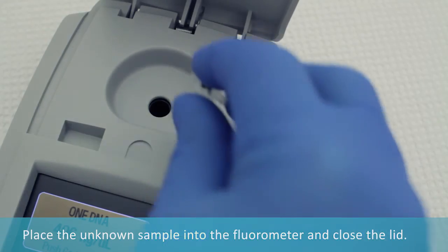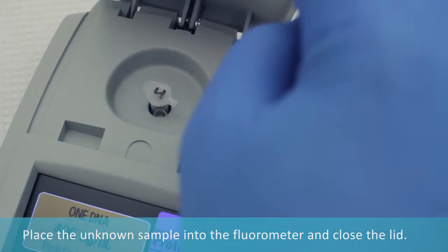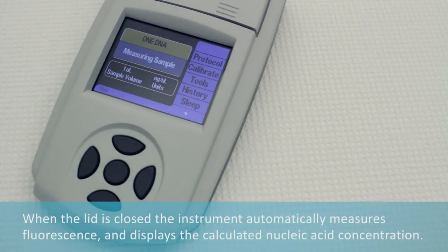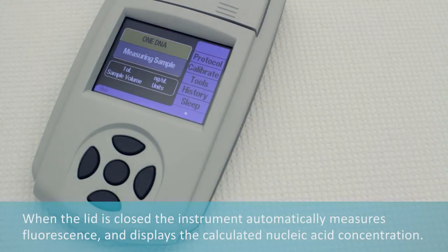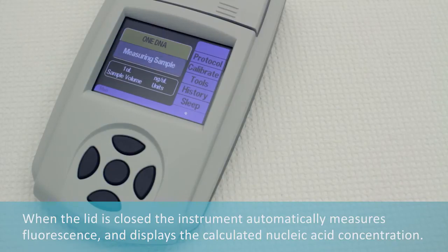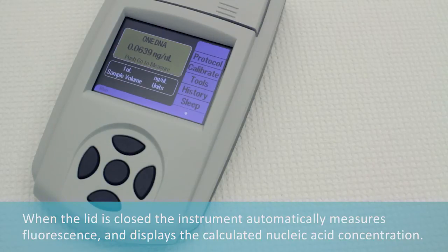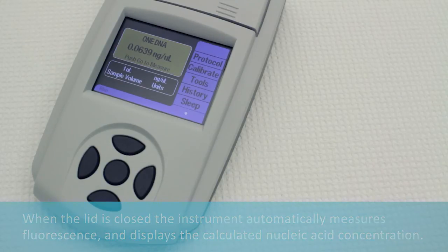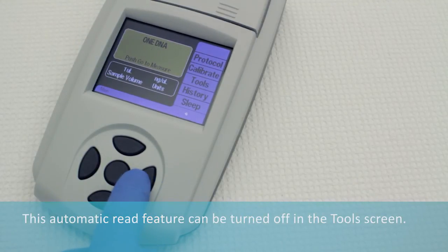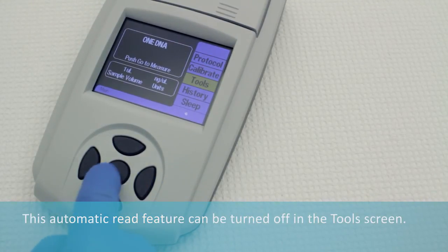Place the unknown sample into the fluorometer and close the lid. When the lid is closed, the instrument automatically measures fluorescence and displays the calculated nucleic acid concentration. This automatic read feature can be turned off in the Tools screen.